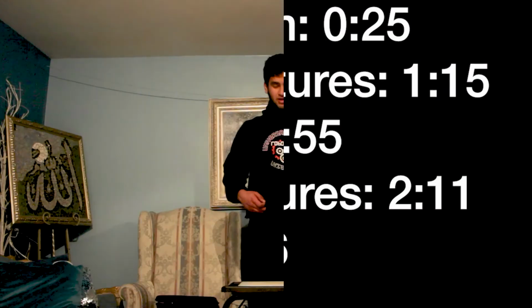Today I'm going to give a basic overview on the renal system, followed by a dissection of 2 kidneys, and finally finishing off with a description of a common disease that affects the renal system. Here's the timestamps just in case you want to skip to a certain point. Okay, without further ado, let's get started into an overview of the renal system.